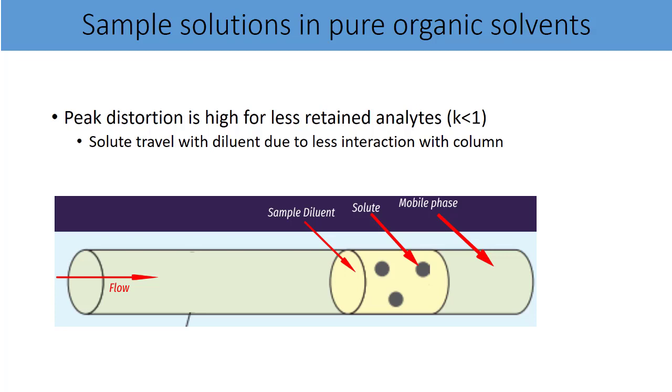The degree of distortion will be much higher if the retention time is lower, because your solute molecule will travel along with the diluent and will have less interaction with the column. You can see a similar scenario in the diagram here. The solute molecule is traveling along with your sample diluent and ends up with a highly distorted peak shape.